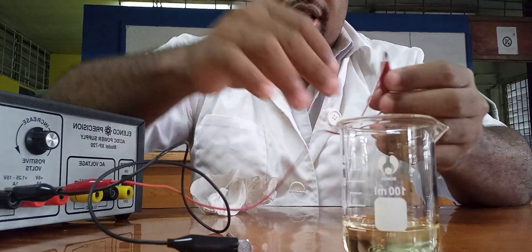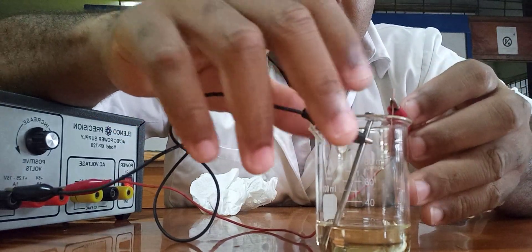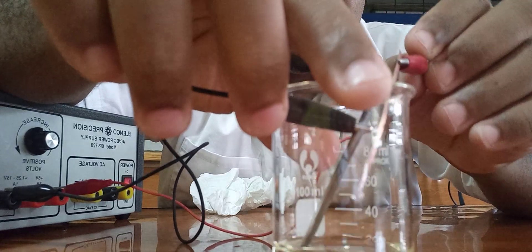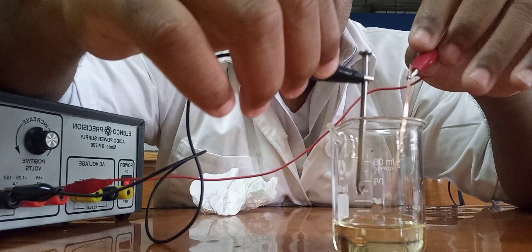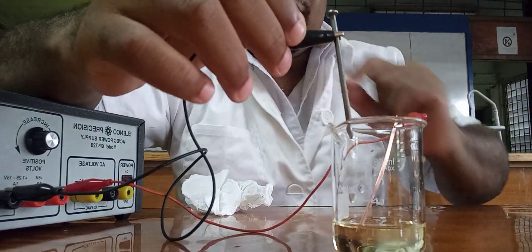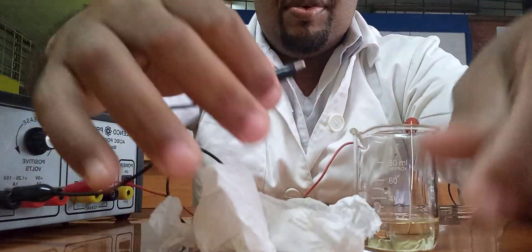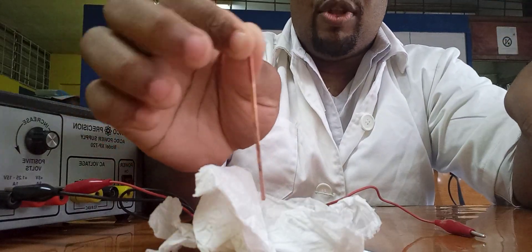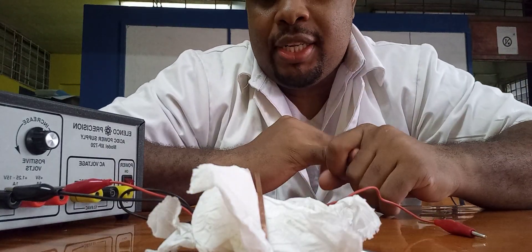So the last one — the cooking oil. This experiment was highlighting some substances that are electrolytes and some that are not. From the theory, ionic compounds — salts — would be electrolytes when molten or in solution. Here we have them in solution. Strong acids are strong electrolytes; weak acids are weak electrolytes, and we saw that.